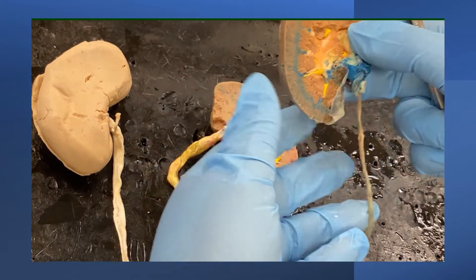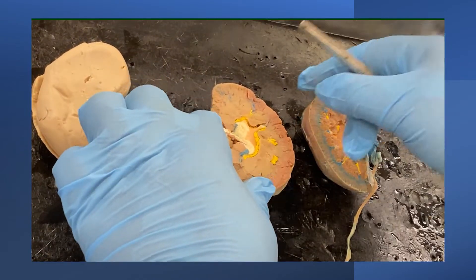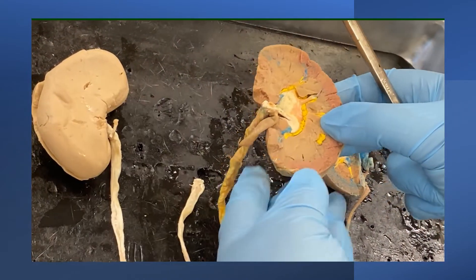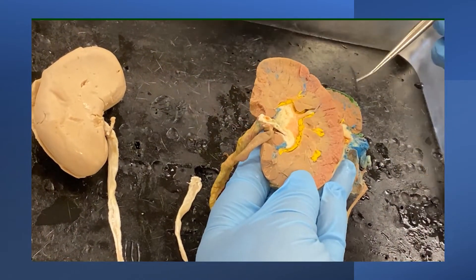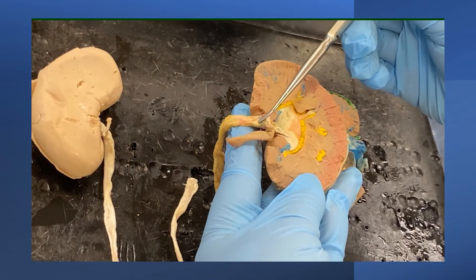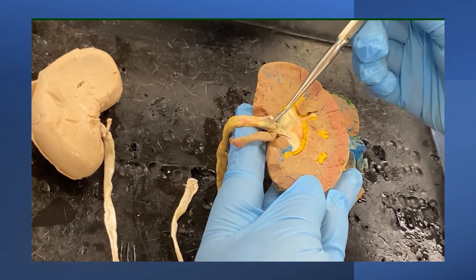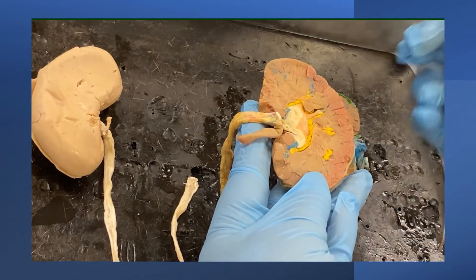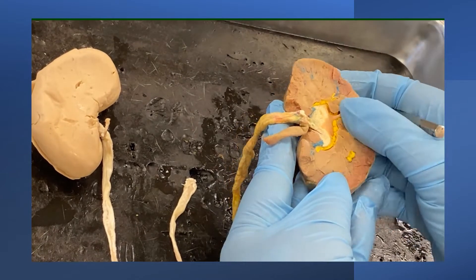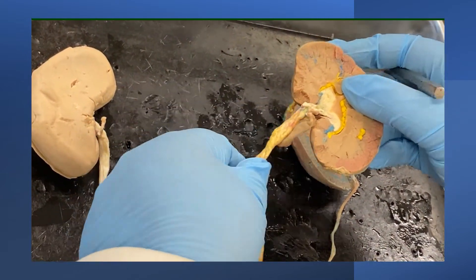We will look at another section. Here you will be able to see the renal pelvis more distinctly, which will then be continued as the ureter.